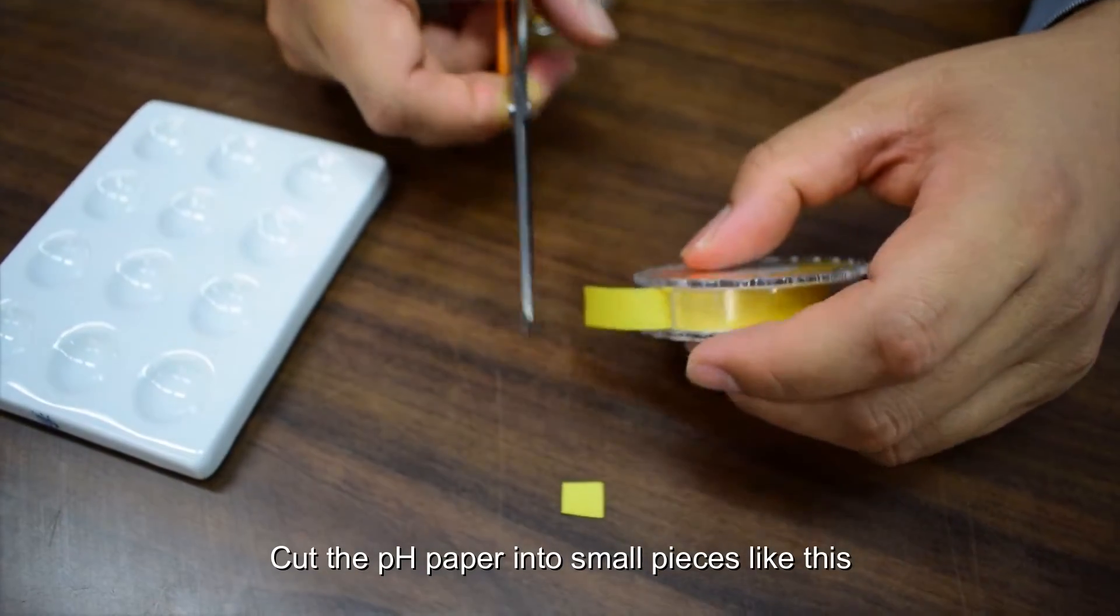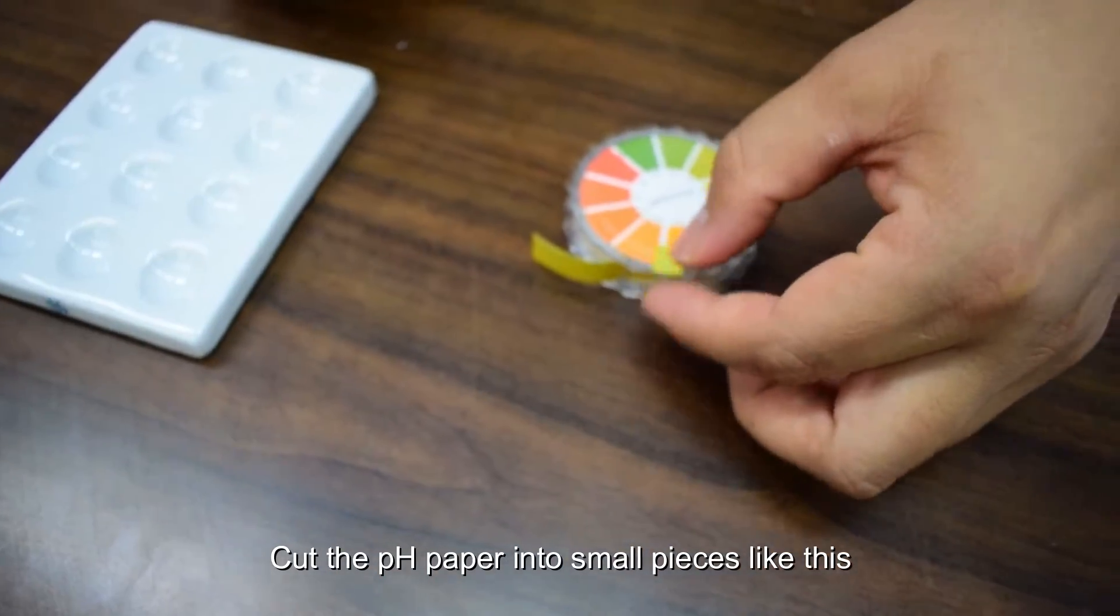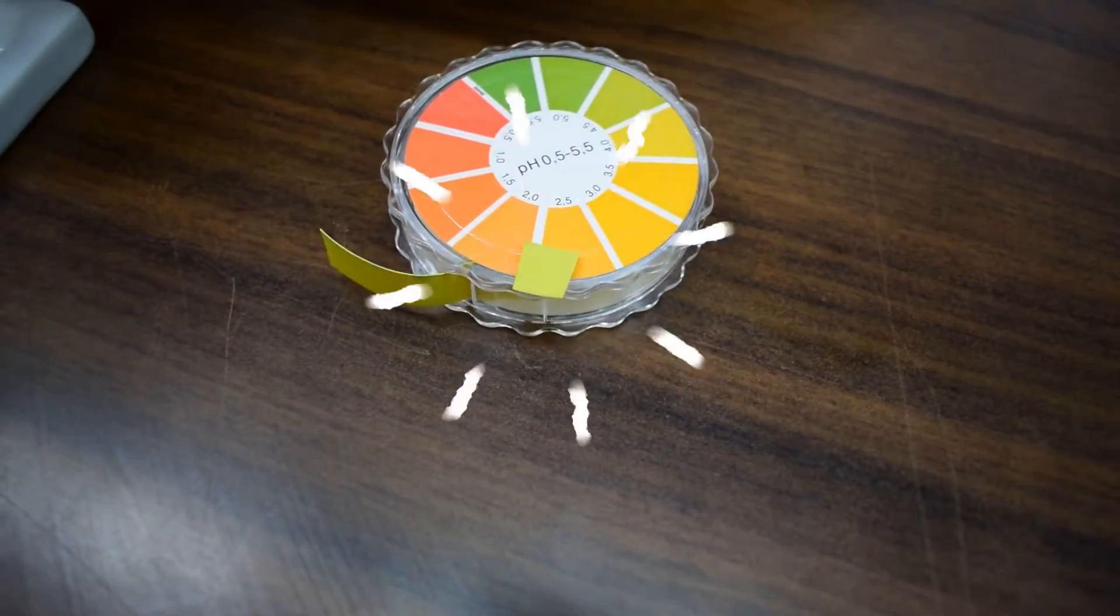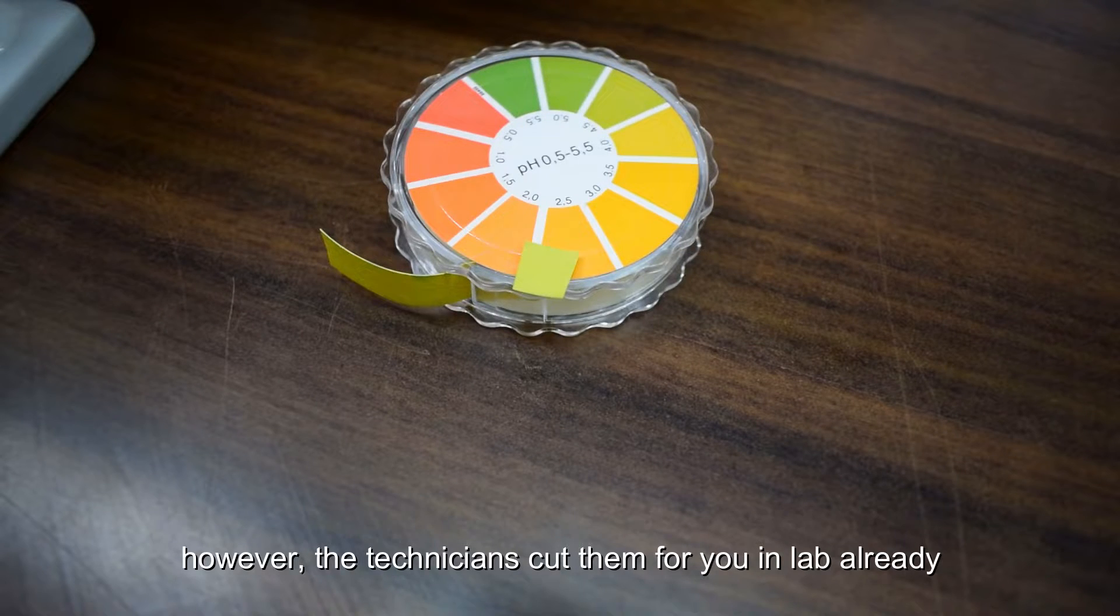Cut the pH paper into small pieces like this. However, the technician cuts them for you in the lab already.